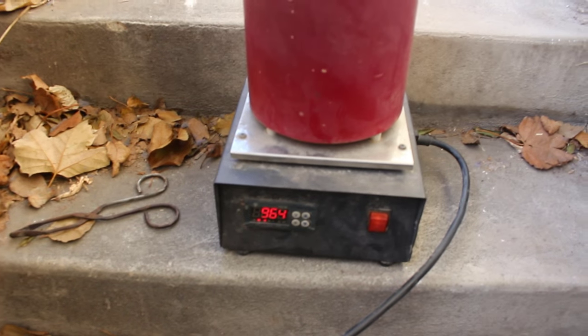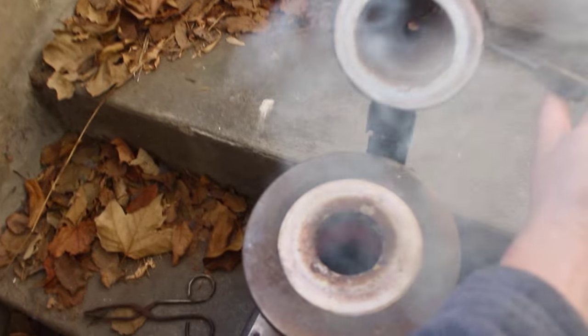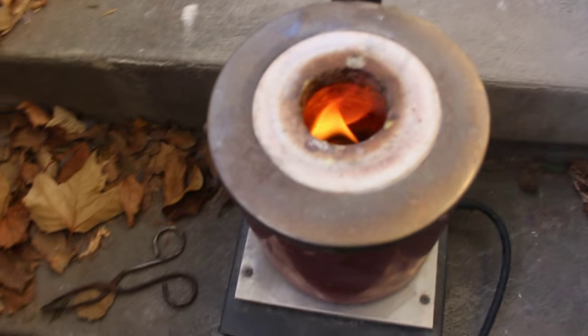Okay, we're at almost a thousand degrees Fahrenheit. We got a little bit of smoke coming up. Let's have a look in there. Oh, caught fire. Yeah, there's definitely carbon in that paint then.